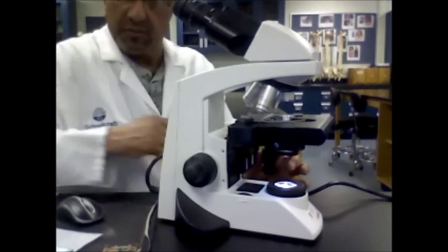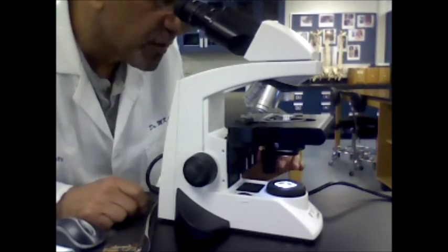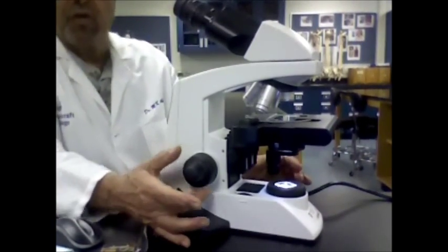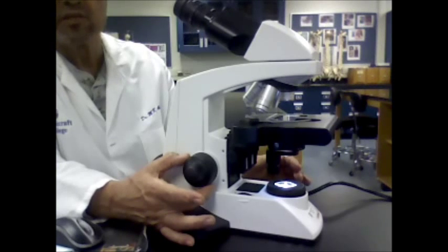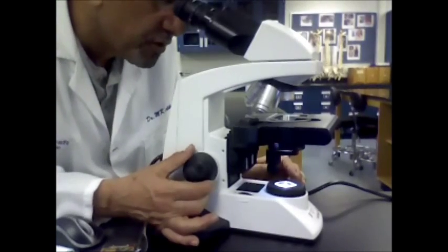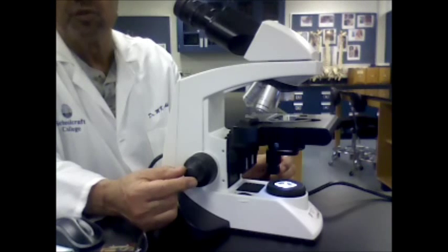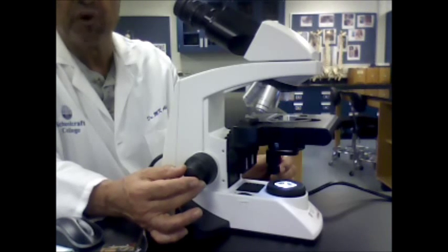Find your specimen under the scanner or the low power. After you find it, go ahead and focus it. You start with the larger knob on the side of the microscope, which is known as the coarse adjustment knob — use that first to focus. If you need to, you can use the smaller knob on the outside, which is known as the fine adjustment knob, for fine focusing.